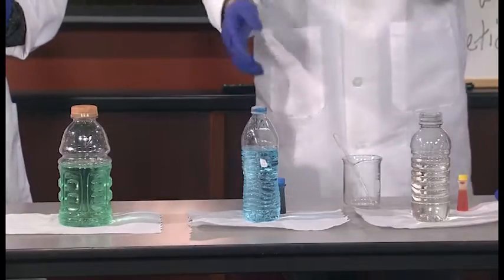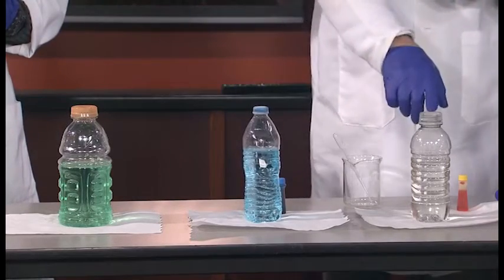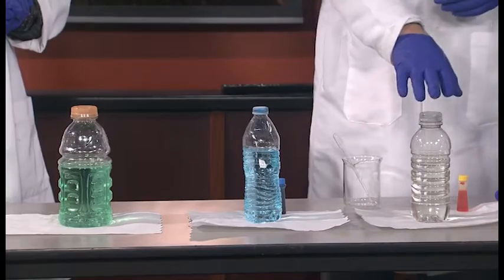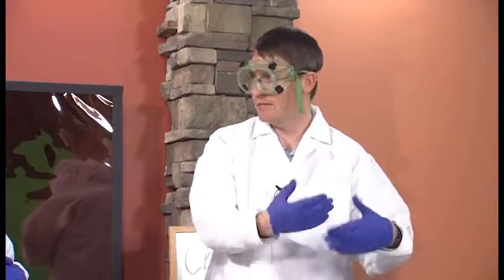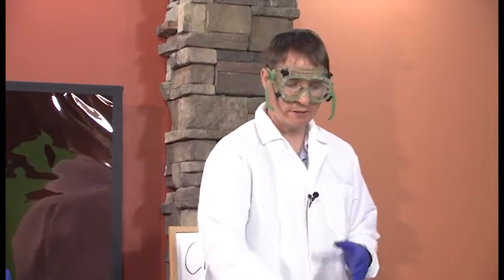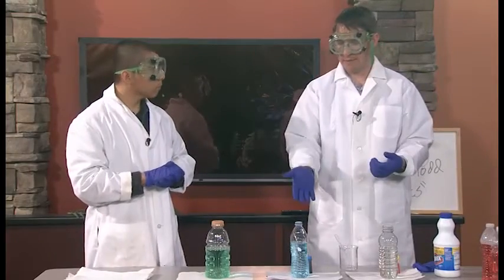And if we give this maybe, rather than just 1 minute, if we give it 5 minutes or 10 minutes, eventually this solution will look exactly the same as this solution. So in this example, we have the bleach react with the yellow food dye very, very quickly. Just a few seconds is all it takes to fully react. With the blue food dye, it may take several minutes. So we'd say that it reacts very quickly with the yellow food dye, very fast kinetics with the yellow food dye, and relatively slow kinetics with the blue food dye. So those are our results that we got with yellow food dye and blue food dye.